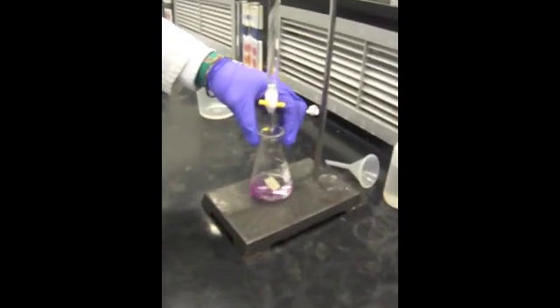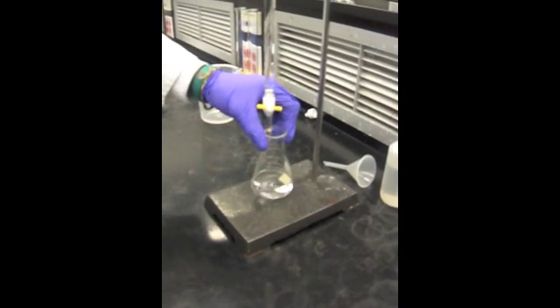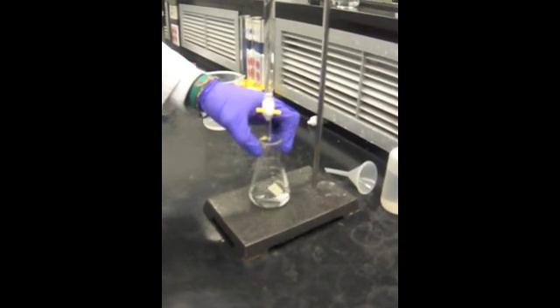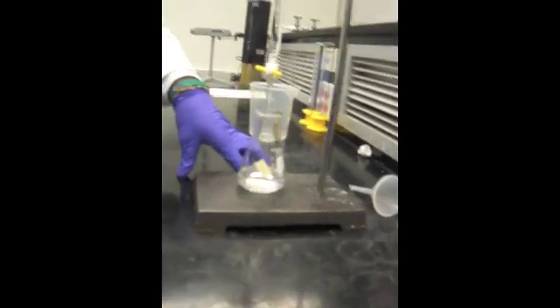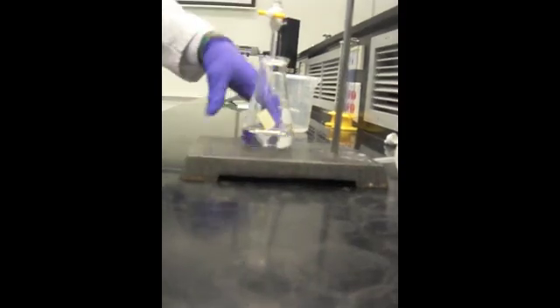You can tell as it starts, it has a pink color to it. Whenever it gets to this state, you just want to swirl it around and it's going to disappear. You want to continue to do this until the pink color stays in longer than it did before.